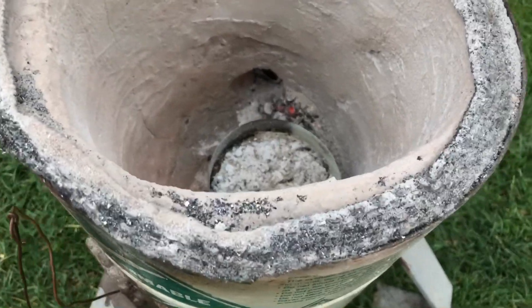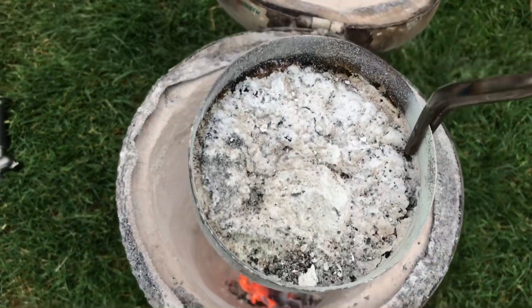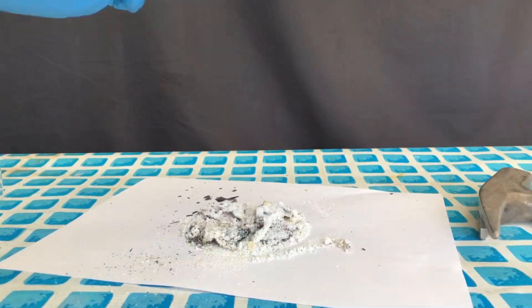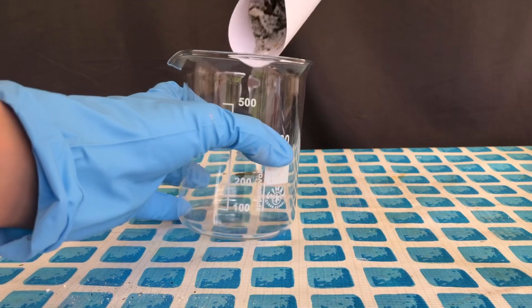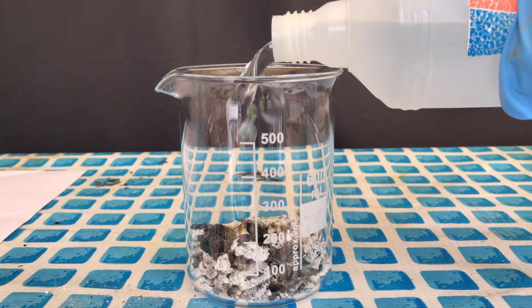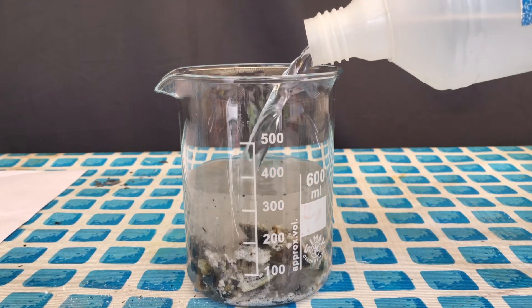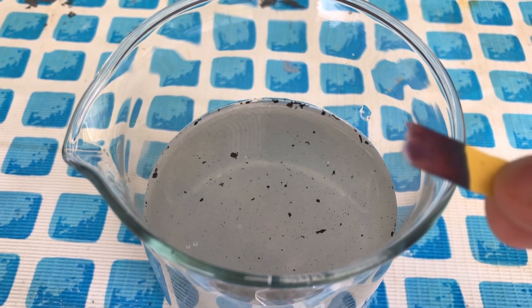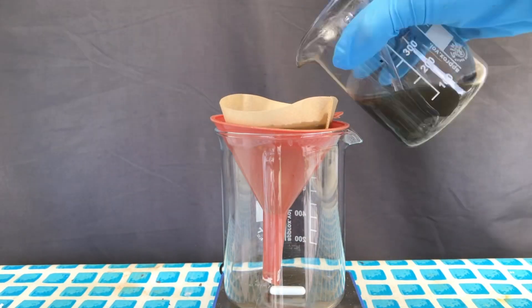After some time had passed, we simply took out the reaction can. It is impossible to react all of the sand with the sodium hydroxide at these temperatures, because even higher temperatures would be needed to completely fuse them together. Anyway, we took the mixture out of the container, added it to a beaker, added some distilled water, let it sit for two hours, and afterwards filtered it. A lot of sand will be left behind, and a lot of sodium hydroxide remains in solution, as you can see here because it's strongly alkaline.